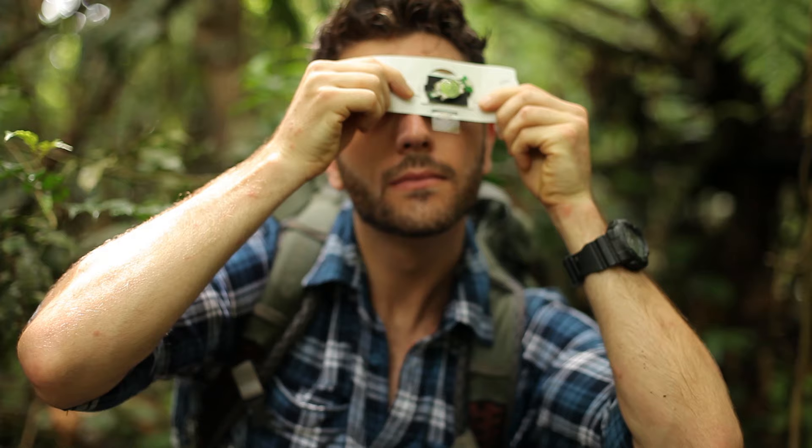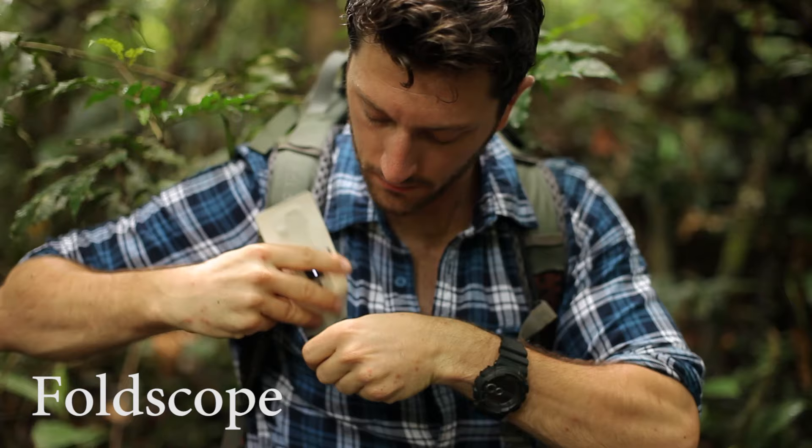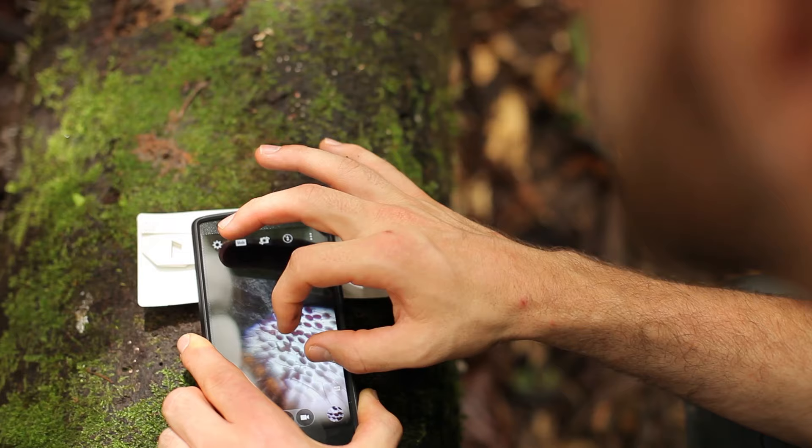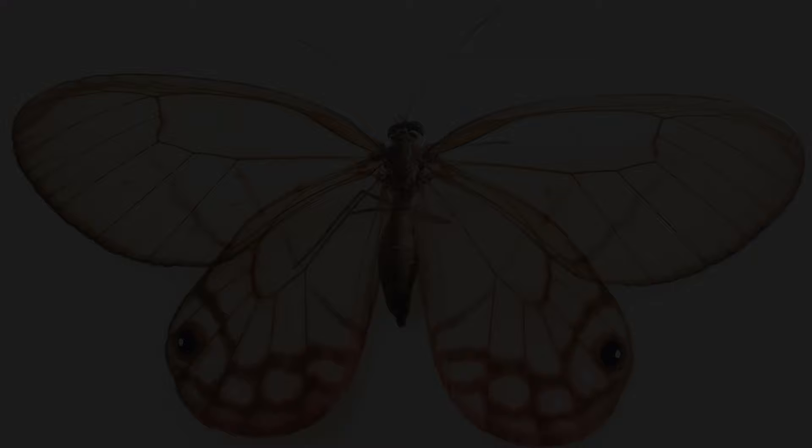Part of researching these elaborate nanostructures requires high magnification, so I've started using a foldable microscope to take a closer look at the wings without leaving the field. Here I'm investigating a blushing phantom butterfly, and I'm able to zoom in on those microscopic scales over 140 times with just the foldscope and my cell phone. As technology becomes cheaper and more portable, scientists can take their equipment out into the field to do research and make discoveries in real time.